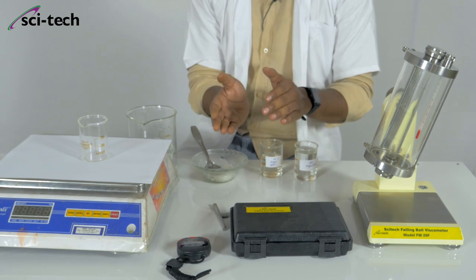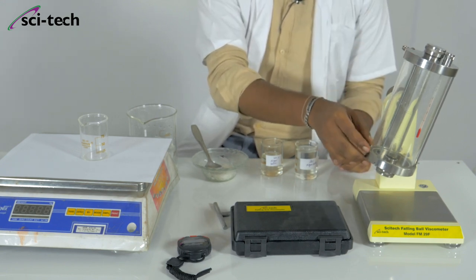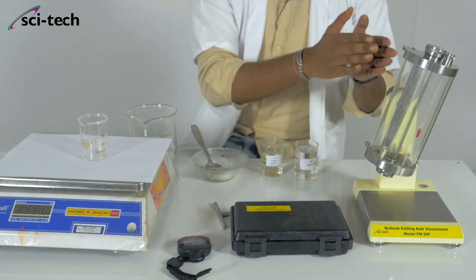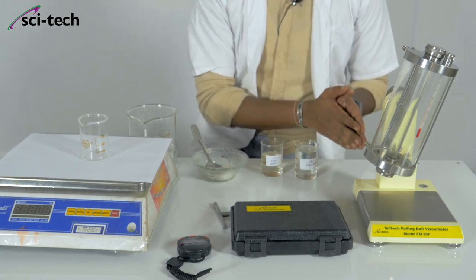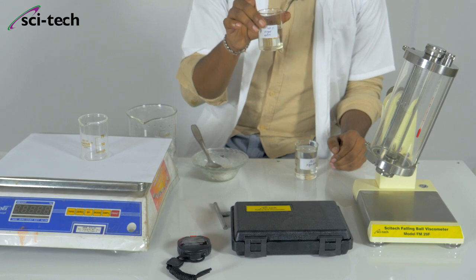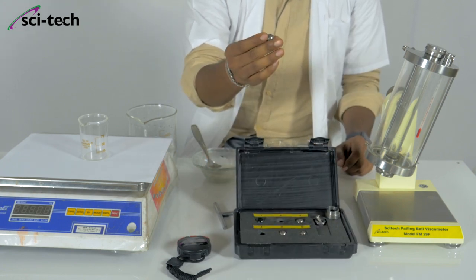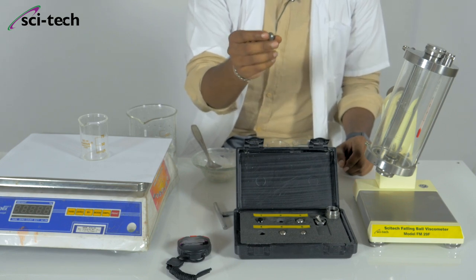After calculating the density of the solution, we pour it inside the falling ball viscometer and insert the ball. The ball comes from top to bottom under gravity at 10 degrees using the bevel screws. We record the time and use the mathematical formula to calculate dynamic viscosity. Another advantage of this inclined falling ball viscometer is that we can also calculate the kinematic viscosity. The metal and glass balls have known constants and diameters measurable with a vernier caliper, and their ball constants help with the mathematical formula.